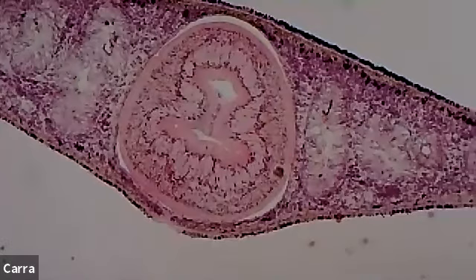You see how one is right next to the pharynx, and then it gets a little bit smaller, and that's next to that, and then it's a little bit smaller, and that's next to that as you get closer and closer to the very edge. So those are all different branches of that gastrovascular cavity that we were looking at earlier. Remember we were looking at the planarian, and I was showing you all of those black squiggly lines that go all throughout the body cavity. That's what we're looking at here. So the gastrovascular cavity has lots of different channels, and it goes throughout the entire body of our planarian.